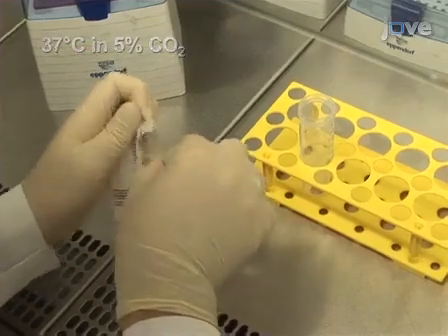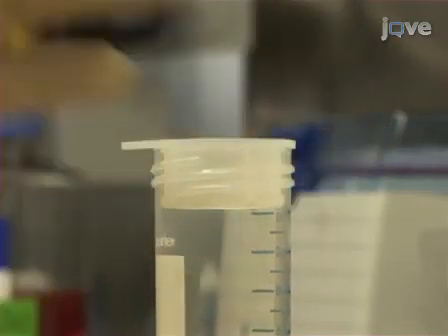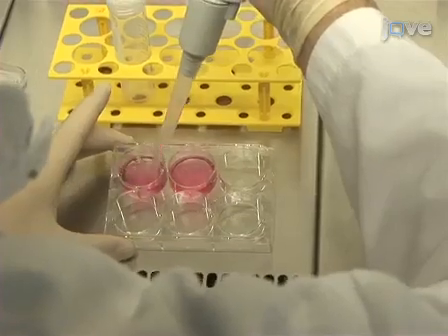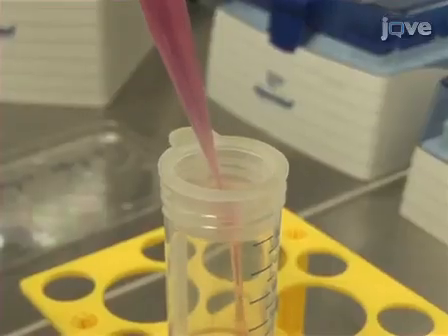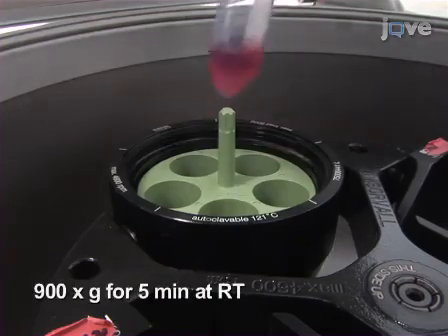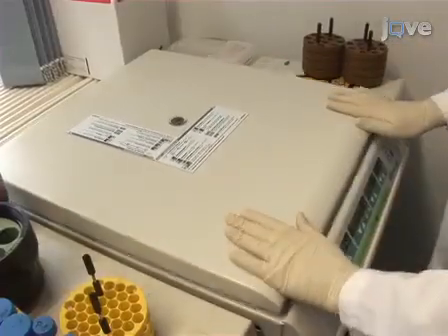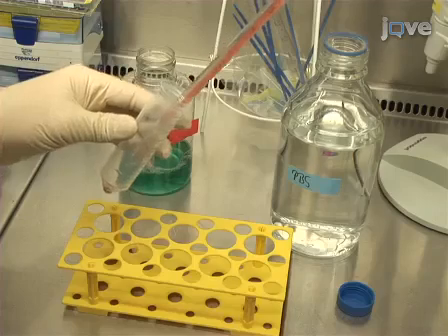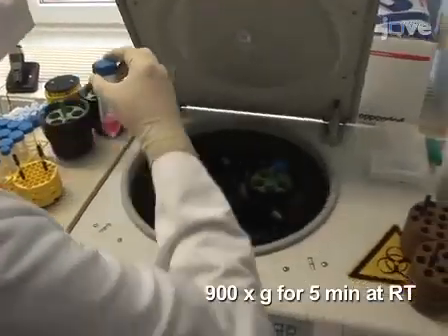To harvest the fluorescently labeled spores, place a 70 micrometer cell strainer on top of a 50 milliliter conical tube. Collect the spores from the plate by pipette and then pass the media solution through the cell strainer into the tube. Next, spin down the cells at 900 g for 5 minutes at room temperature and discard the media. Then, wash the spores with 10 milliliters of PBS under the same centrifuge conditions.